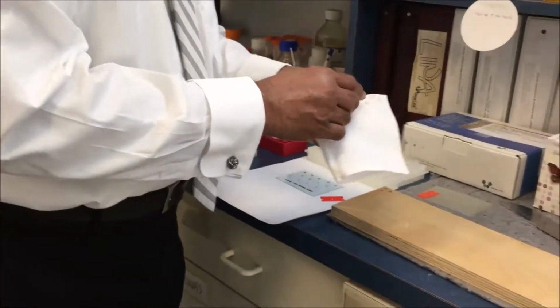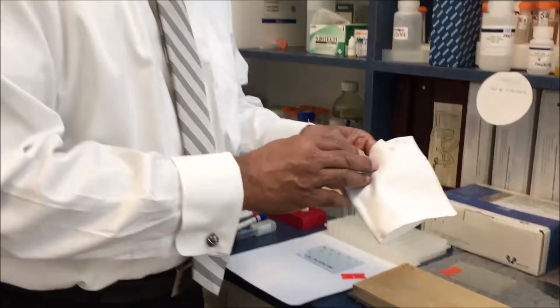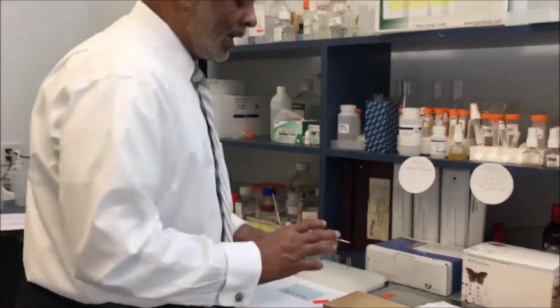From a porous substrate, the usual practice is to cut out the sample where we can visually see it, whereas from any of the solid surfaces, a swab is used. We will show you the use of the swab in session 2, where the sample is collected for processing. Thank you.